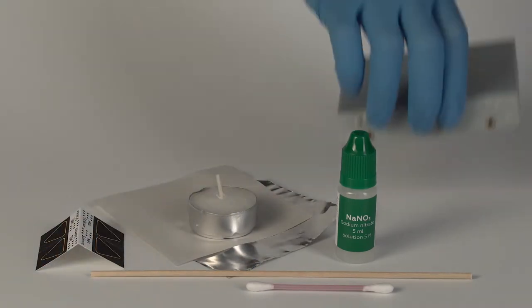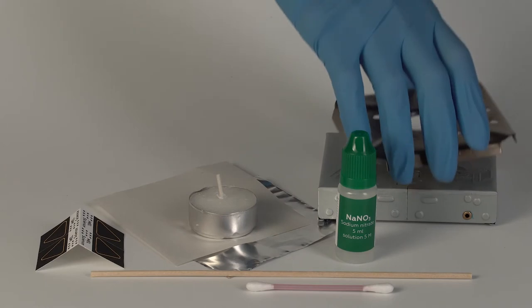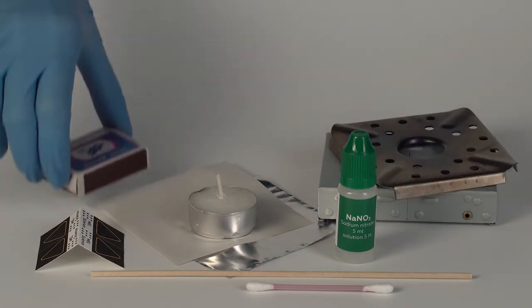From the starter kit, take the solid fuel stove and the flame diffuser. You will also need some matches.